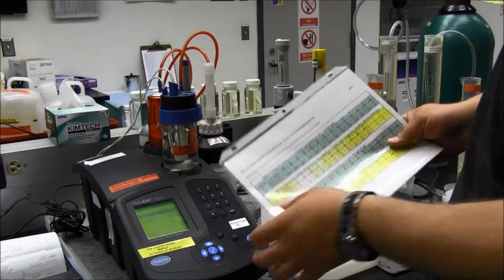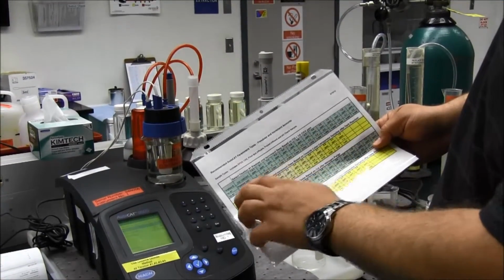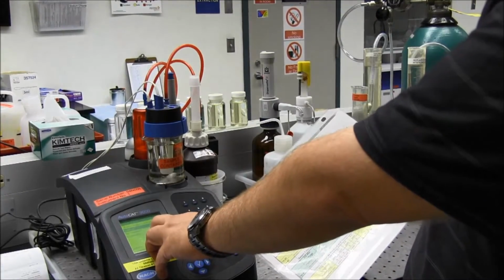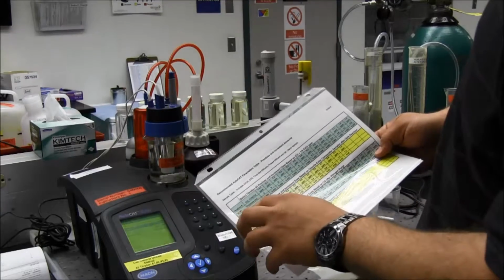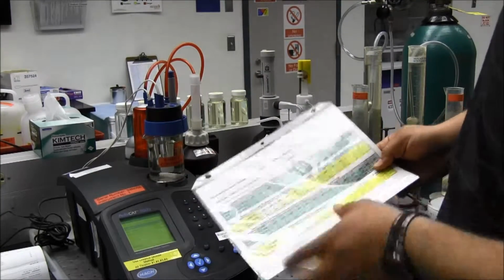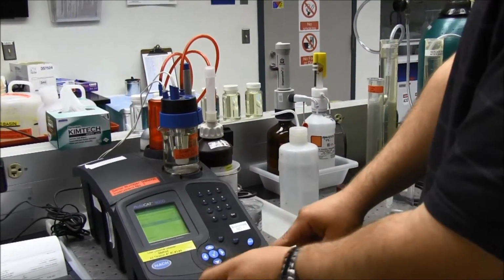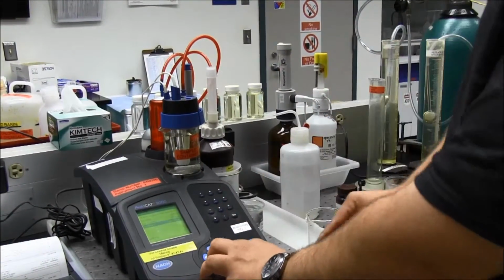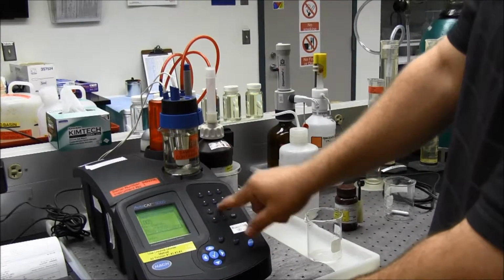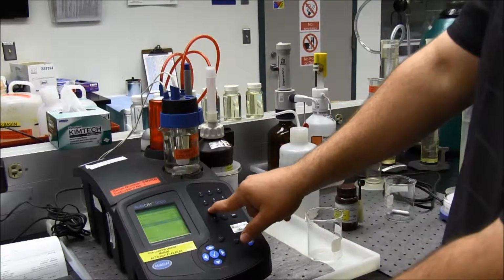So I'm going to take this chart and say 0.9, I'm going to pre-dose at 0.4 milliliters, which is already in there. And I'm going to increment at 0.005. It's at 0.001 right now, so I will tab down to that. I will hit the check mark to change, and I will go 0.005, check mark to enter, and I will confirm, which will be number 1.